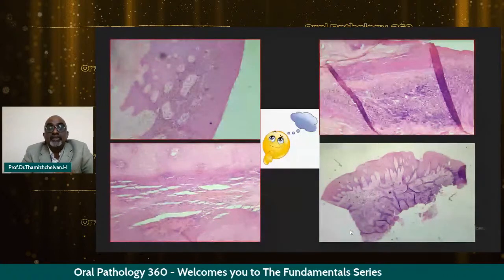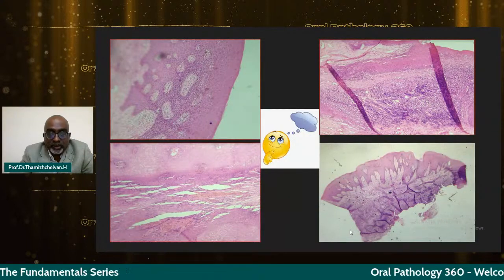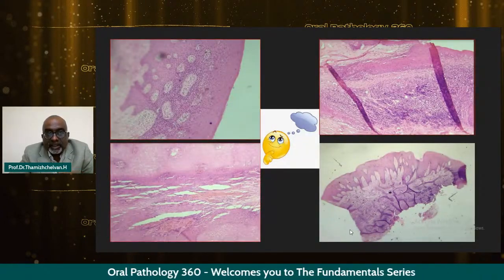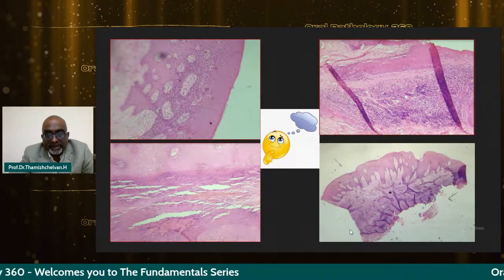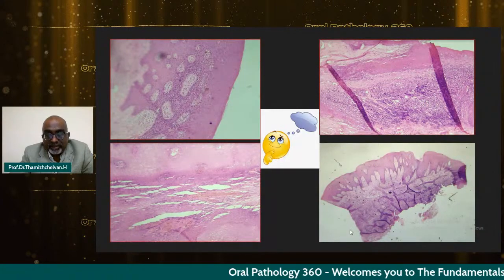Though this is going to be a fundamental lecture and a very basic topic, very few studies have been done both internationally and nationally. When I prepared for this presentation about 15 days back, I reviewed a lot of articles. There is not even a single study done in India about these artifacts. And these are the photographs which I have taken from my department, where artifacts are seen.